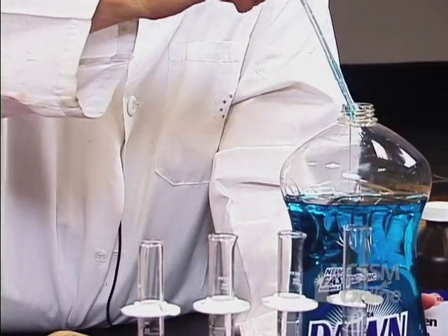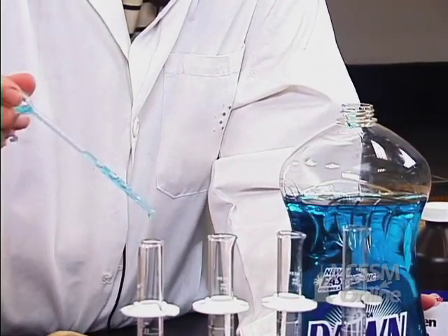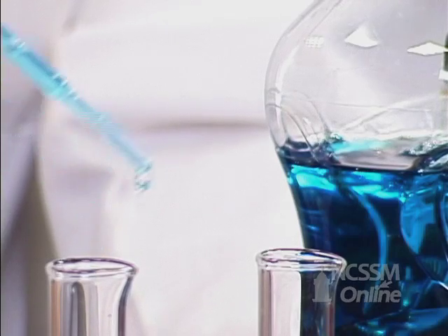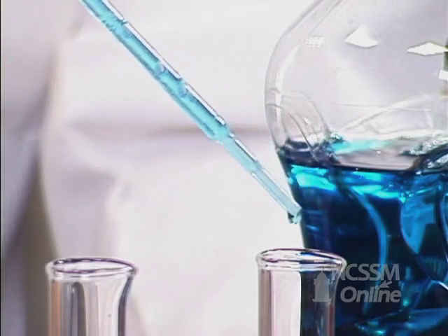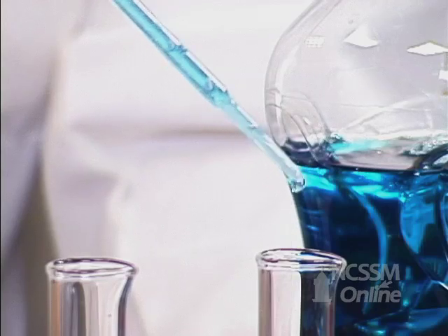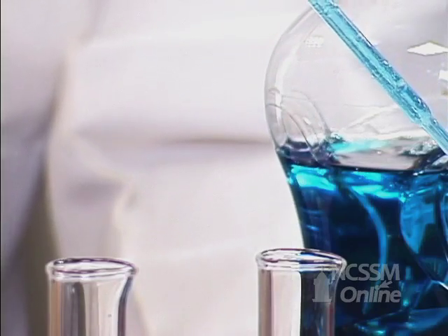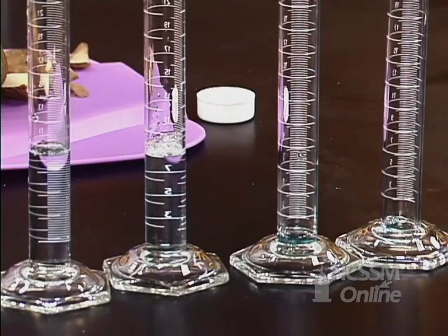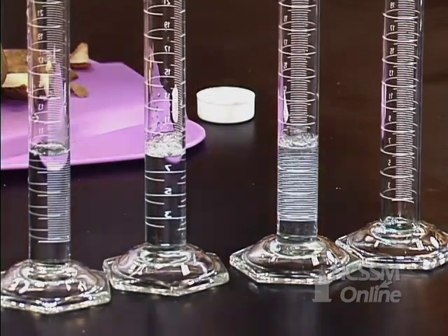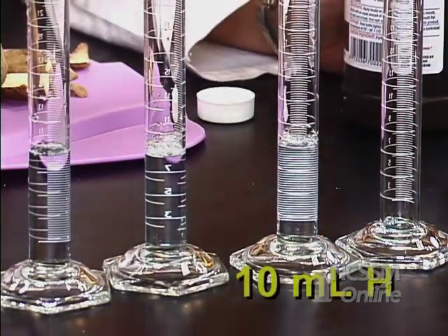In order for us to see the oxygen gas produced, I'm going to put four drops of detergent in each of our graduated cylinders. And then I'm going to add ten milliliters of hydrogen peroxide.